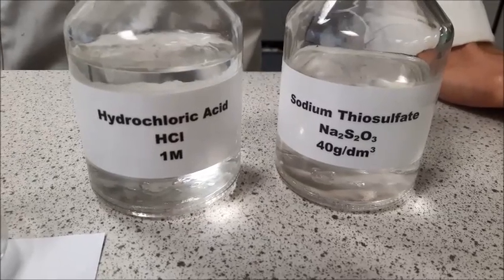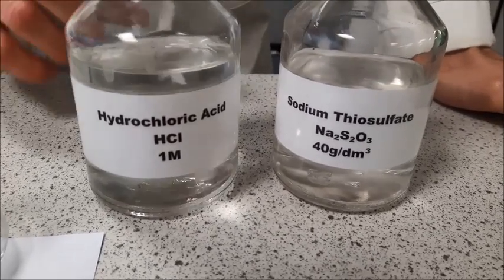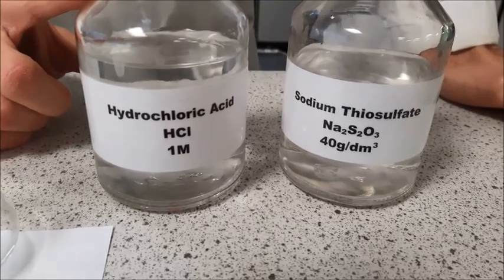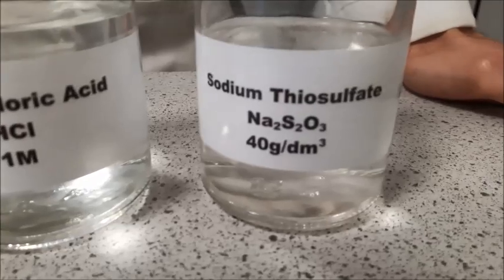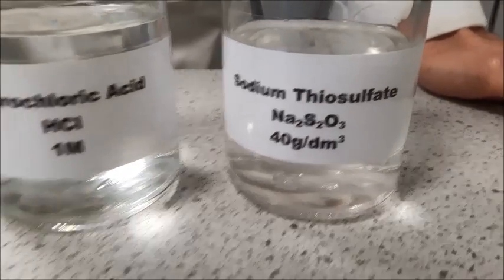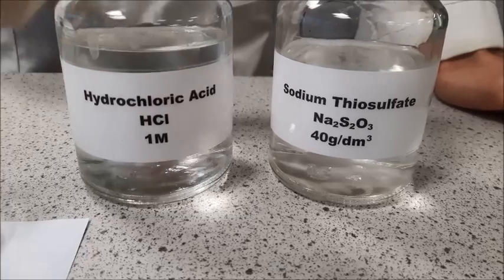This video is for required practical 5 for chemistry, rates of reaction. You are going to need two chemicals for the first part of this practical, and they are hydrochloric acid at 1 molar and sodium thiosulfate solution.